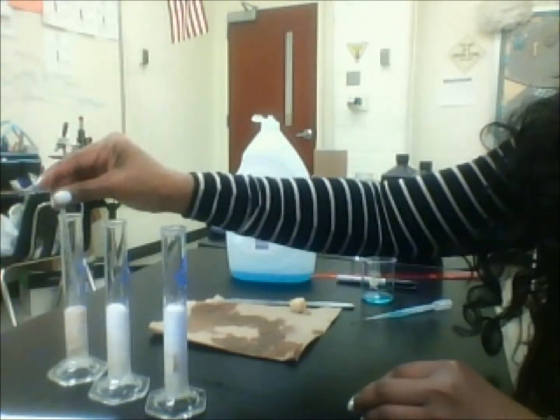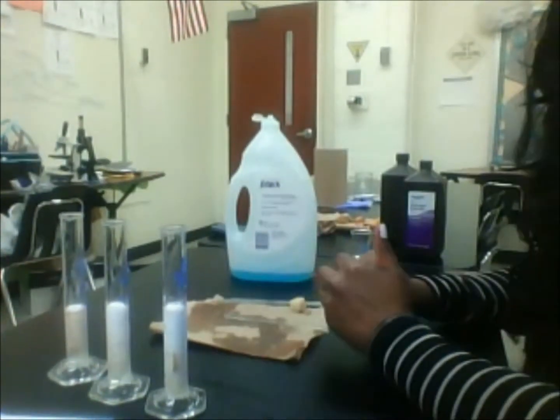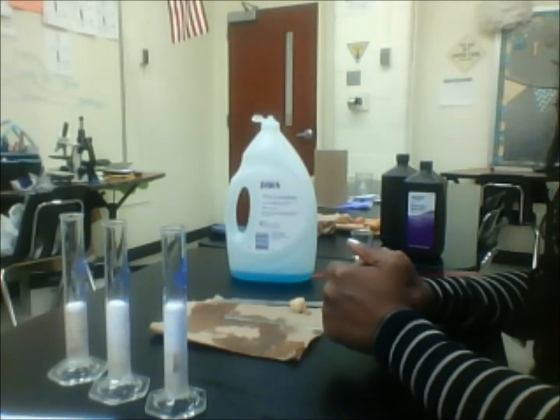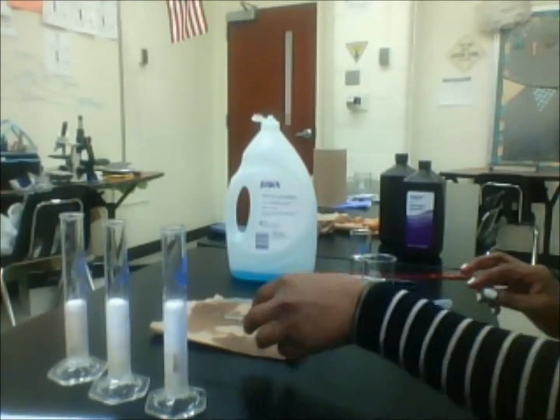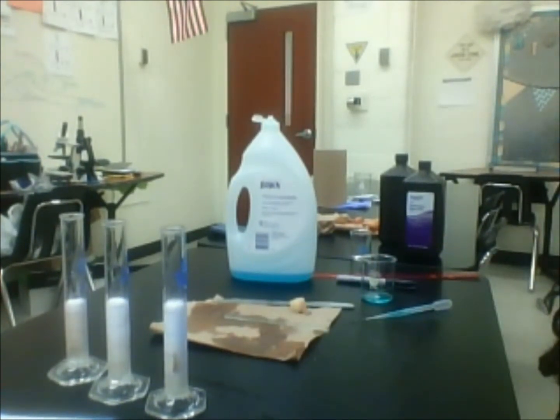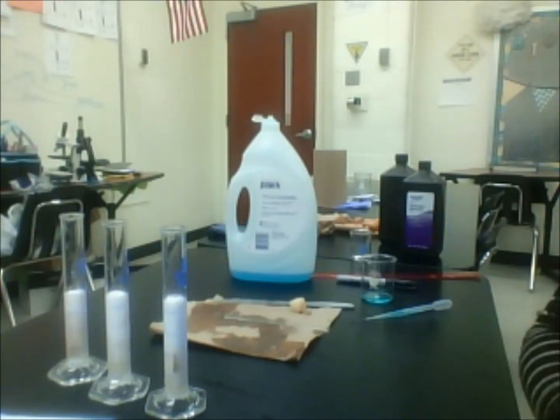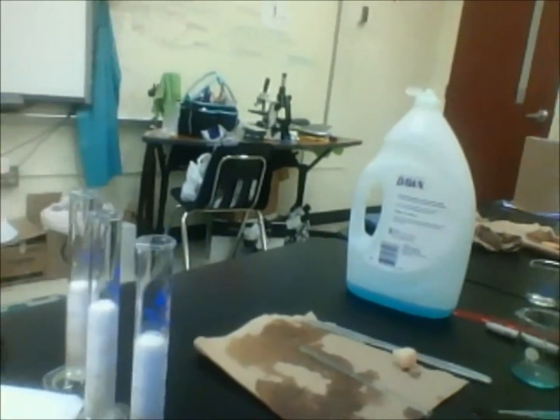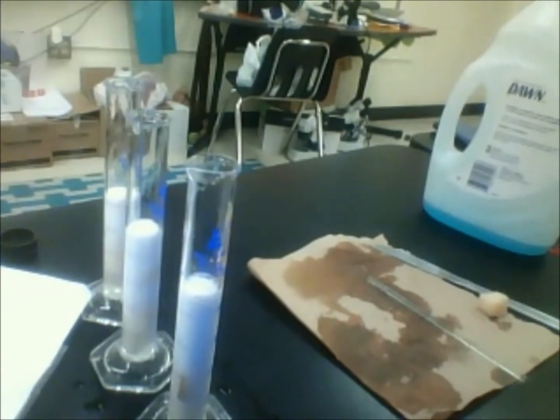Okay, and the reason I wait 30 seconds, because at the end, we're going to measure the height of the bubbles, how high it went. So I want to give us time to actually measure that. So we have about 3 minutes, 30 seconds left with each. You can see that the reaction is occurring. I'll bring this just a little bit closer for you to see, and you can see the bubbles.